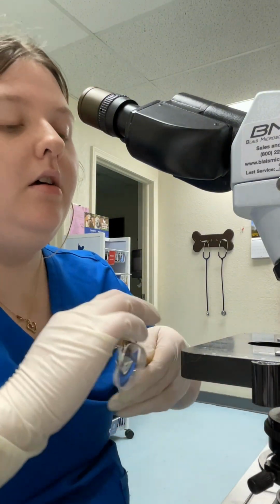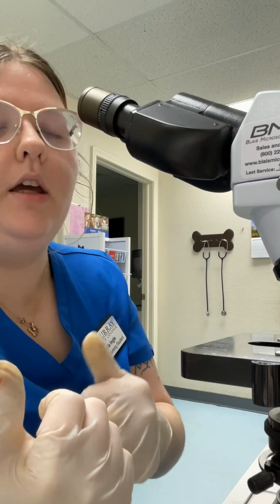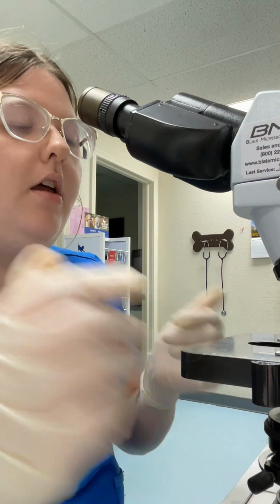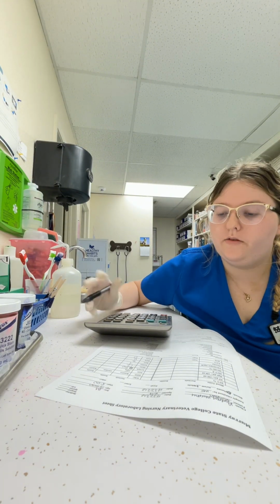Okay, I hit 100, so I'm going to go get our laboratory observation sheet so I can get everything written down there, and then we'll resume to do the absolutes. Okay, now I have everything written down on our laboratory observation sheet.